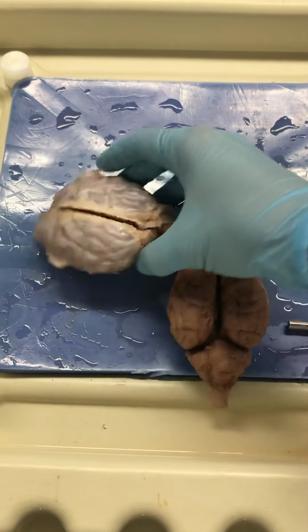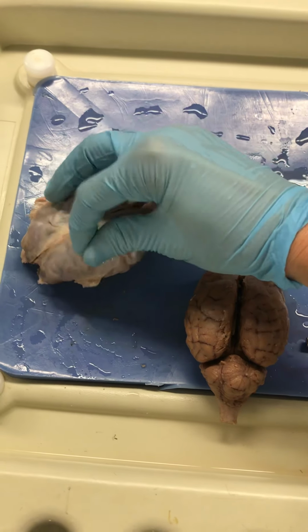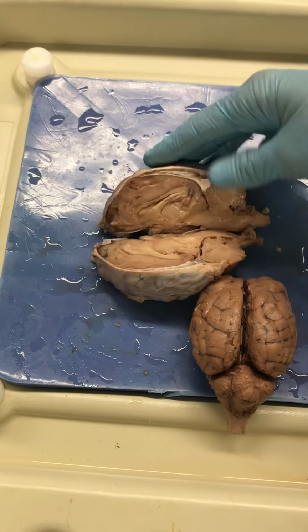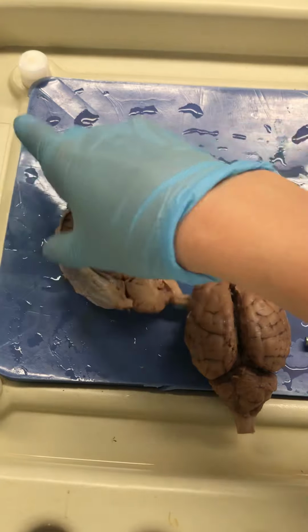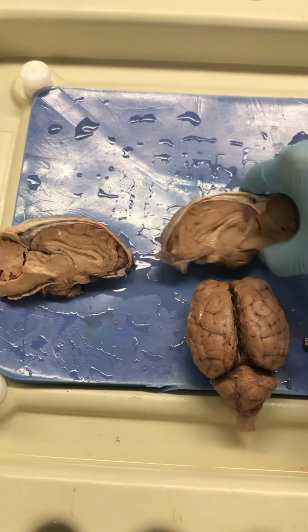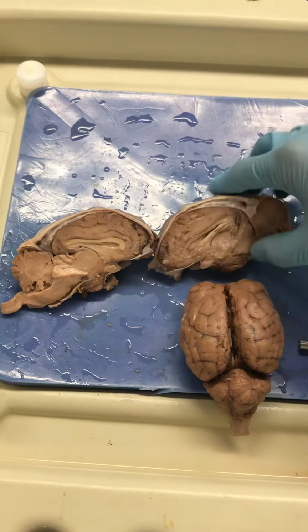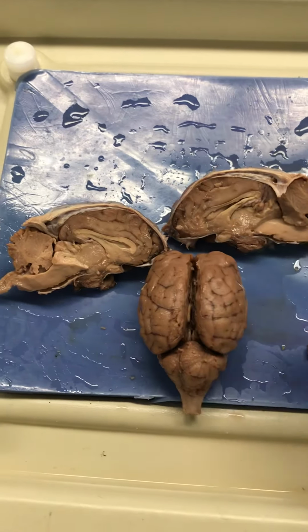This is the meninges, particularly the dura mater, which means tough mother, and it is tough. It surrounds the brain, and it creates these sinuses to help drain blood. It anchors the brain to the ethmoid bone, helps to prevent the brain from jiggling around in your skull.